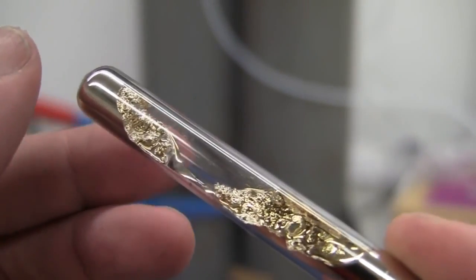So, here we have cesium, which is a liquid at room temperature, and it looks sort of goldy. And it's dropped down a one-meter tube in an argon atmosphere to impact on water. And as you can see, it explodes pretty quickly when it hits the water.